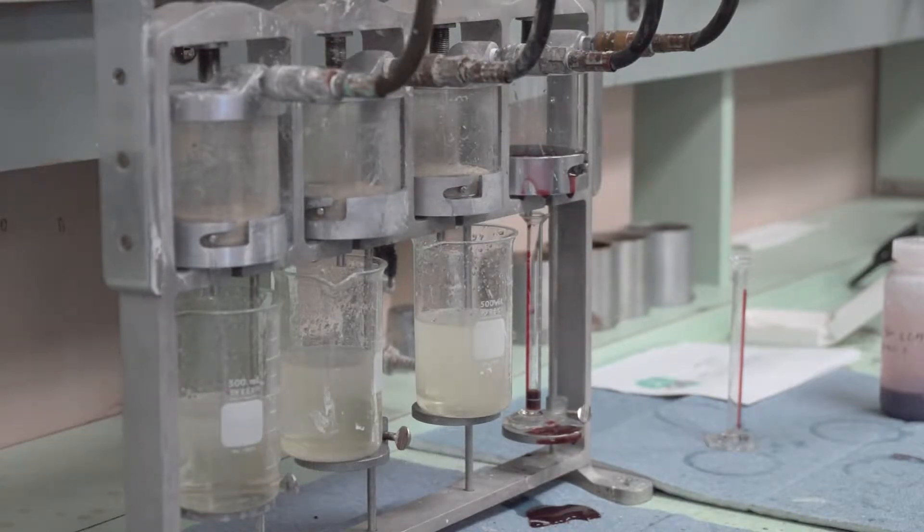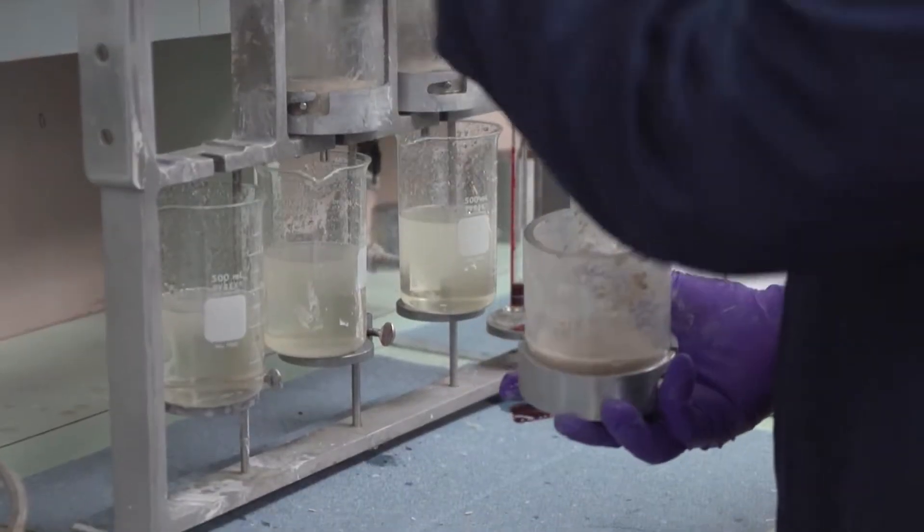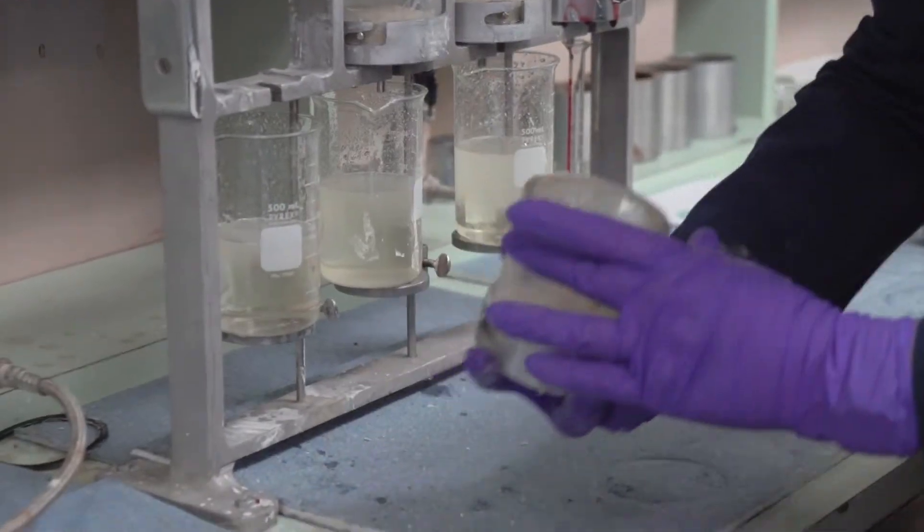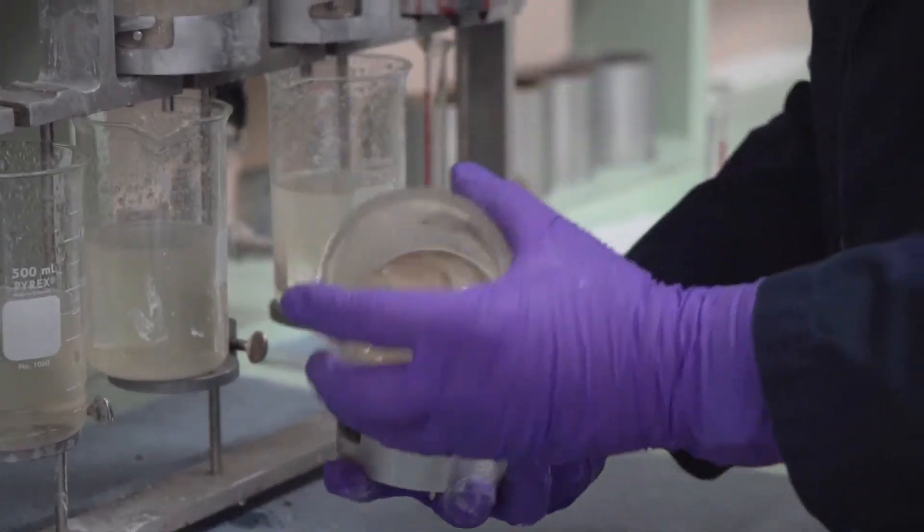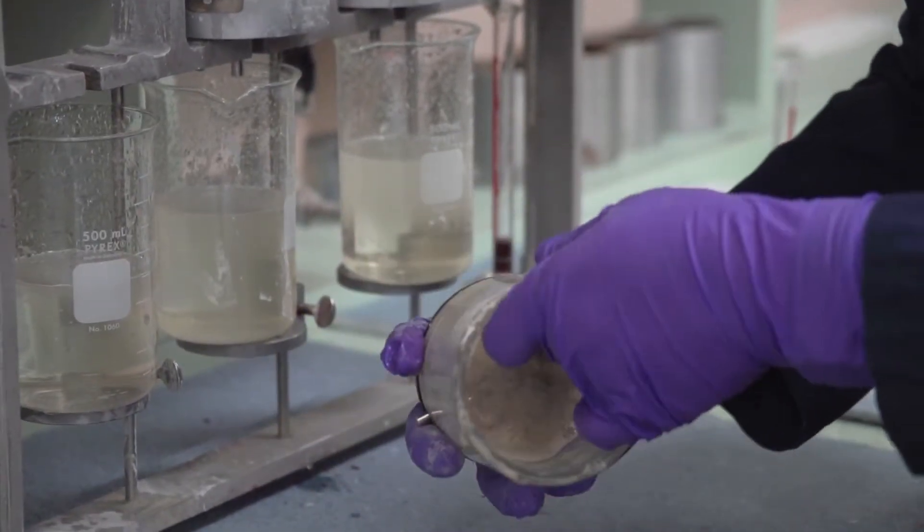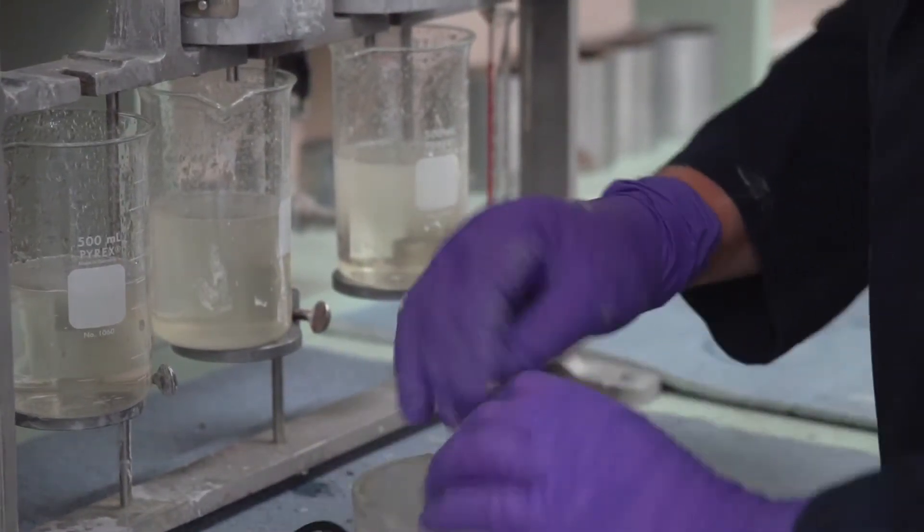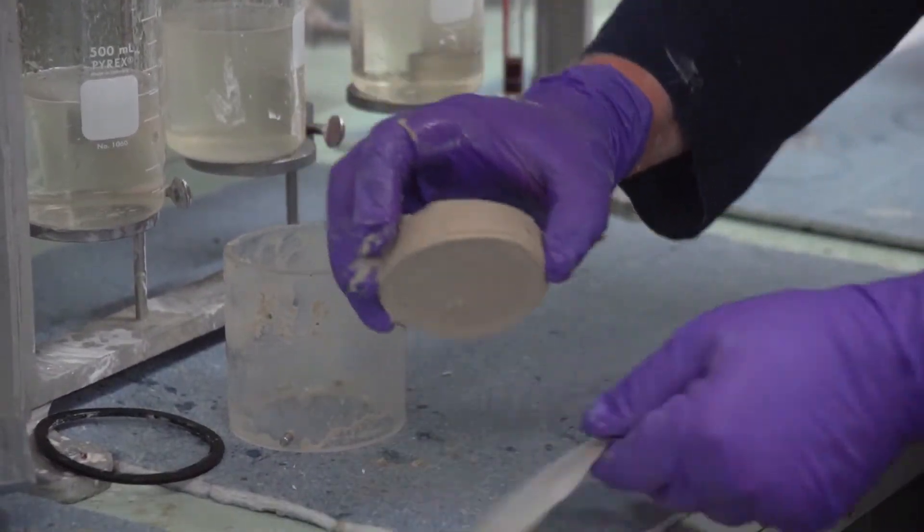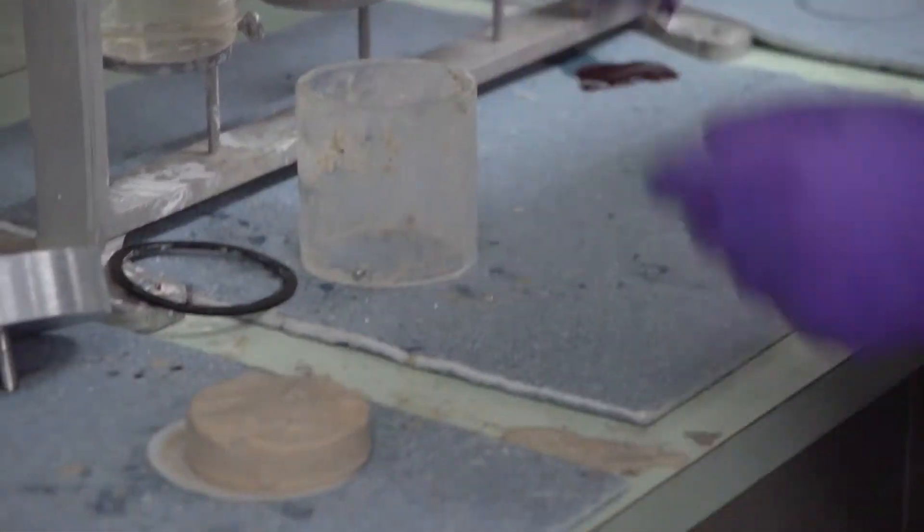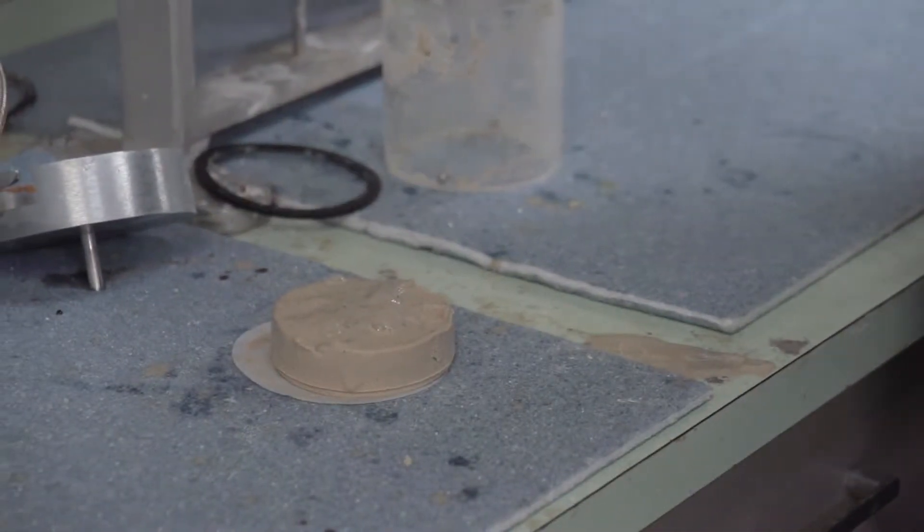They've all blown out now. Set this one aside. This is going to get blown out real well. But as you'll see here, I've got a relatively thick filter cake that is pretty strong. So these two samples will work a little differently.